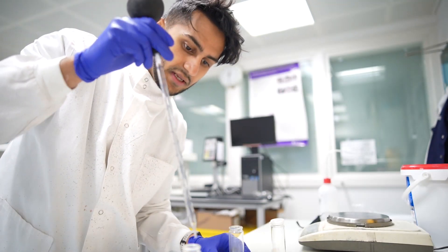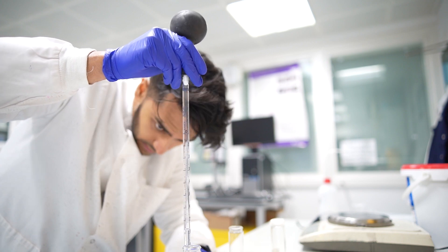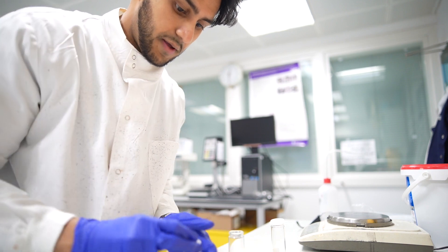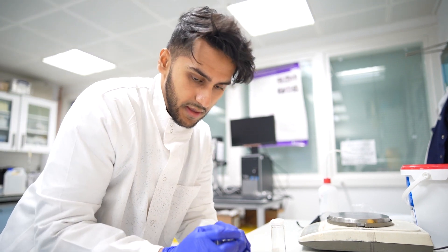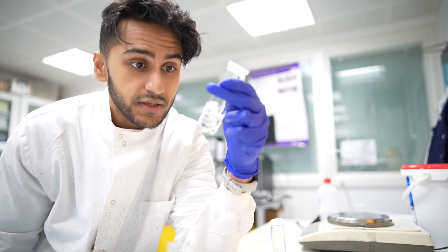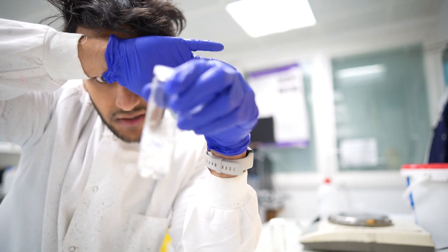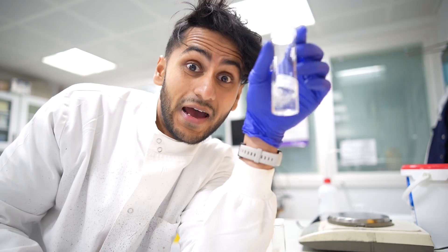I'm going to need two more milliliters of that, so let's take it all the way up to three and then two and plop the rest in. I'll put the caps back on these. Here is our solution that now needs to dissolve — it's already starting to dissolve. What I can do to speed up the process is to put this into a speed mixer, and I'll show you that now.